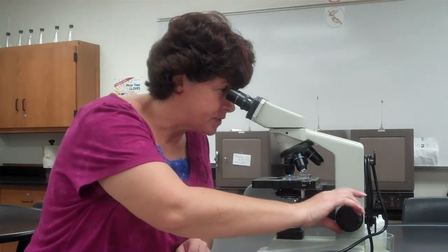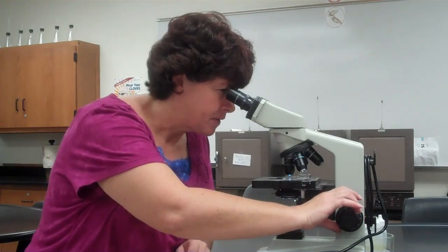So if you do that at the beginning of a lab before you do any microscope work, you're going to have better focusing. It's a little trick that I learned. It takes just a minute. If you skip it, you might have issues with focusing. Okay, so now I'm going to refocus by using my fine adjustment knob on my specimen. So now I found it with the 10 power.